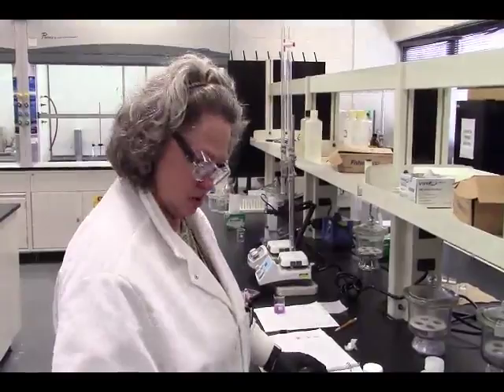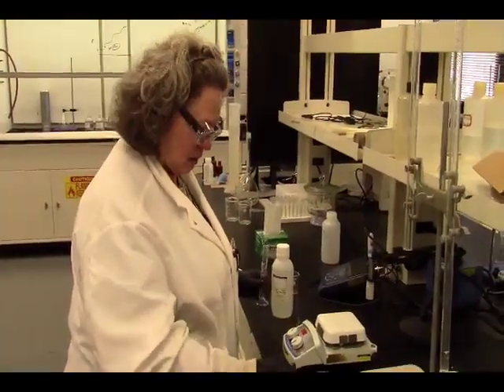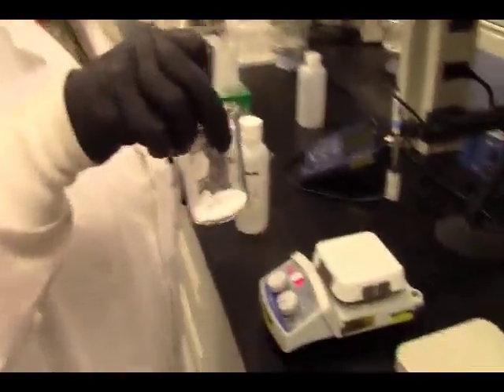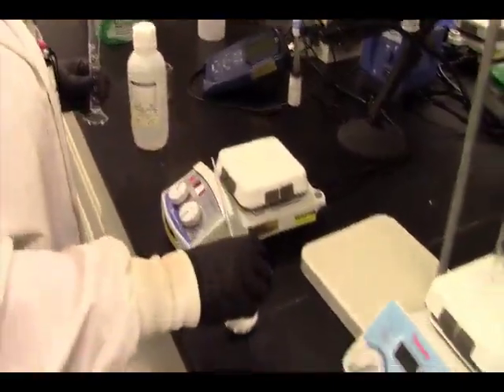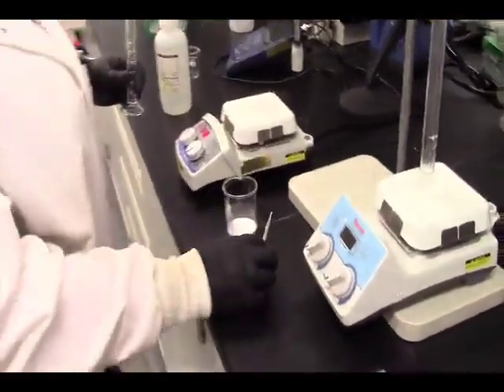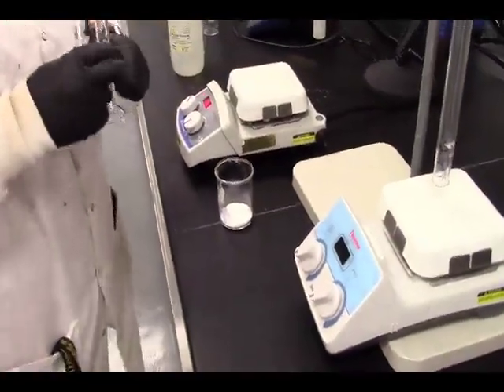We're going to go ahead and get all this stuff together before we actually put it together. Here we have our 4.52 grams of sodium bicarb already added to our beaker. Reading ahead, I noticed that the beaker needed to be large enough for the gas evolution of what we're going to mix with it. So we're going with this volume. Hopefully that's going to be enough since this is the first time we're doing it.